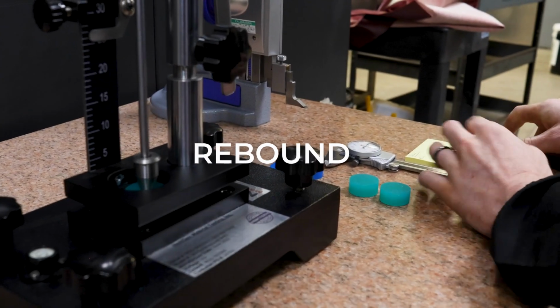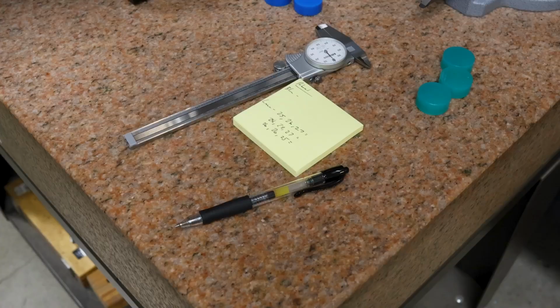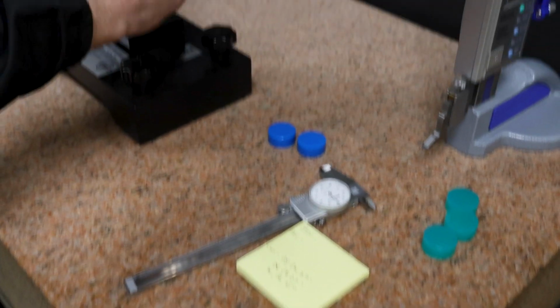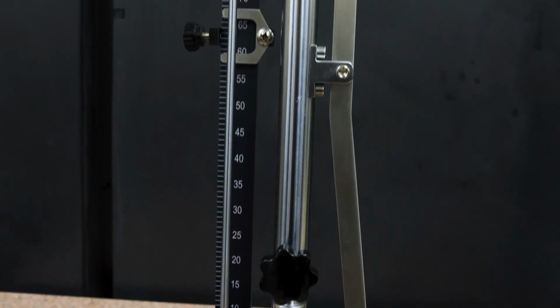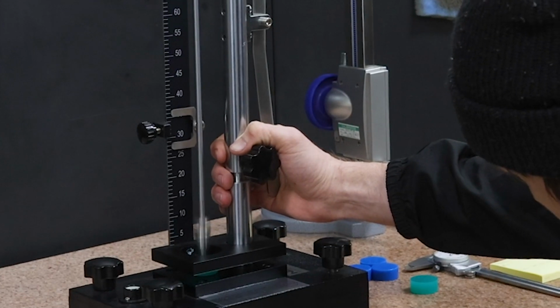Rebound, on the other hand, is sort of the opposite of compression set. It is a measurement of the deflection of a force measured in a percentage. A rebound test is measured on a fixture with a guide rod and a plunger. The plunger bounces off of the specimen, and however high it returns towards its original starting point is your measurement.